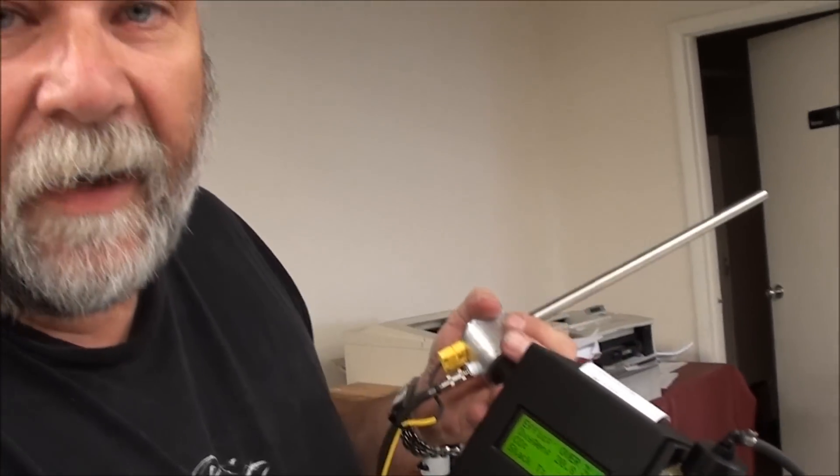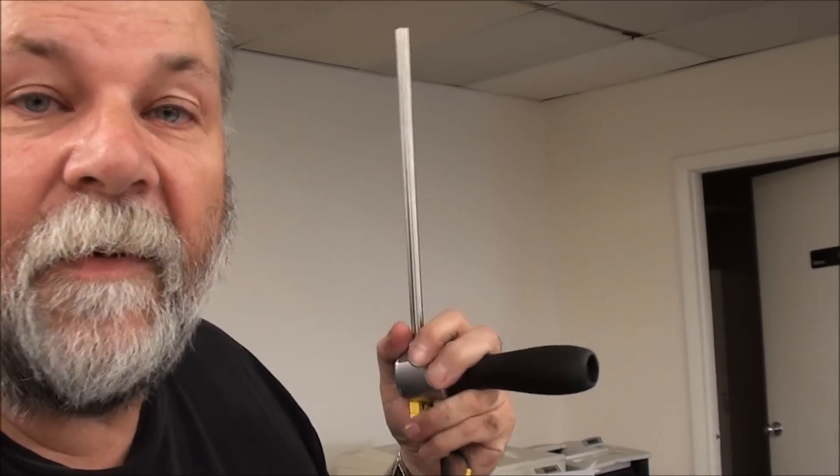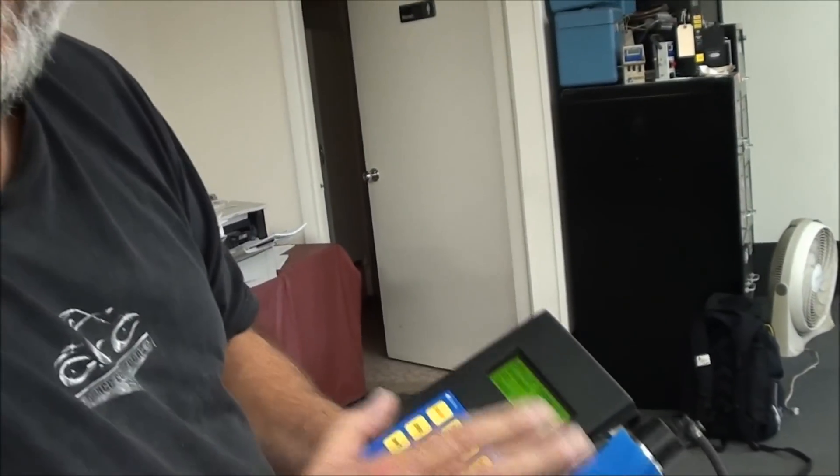At that point, you're finished now with your testing. You've got your data, either a hard copy, a stored copy, whatever you need, and you just simply take the probe out of the stack. Keep in mind that the tip of that probe is going to be very hot, so don't put it on anything that you don't want to damage. Keep it away from plastic, keep it away from your skin, your clothes, until it cools down.